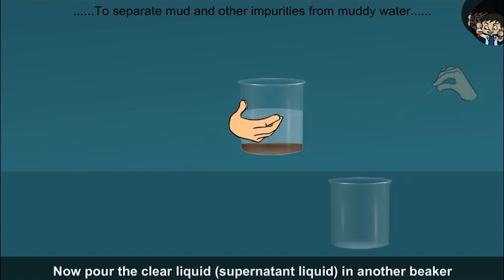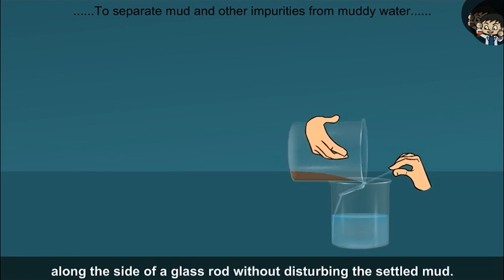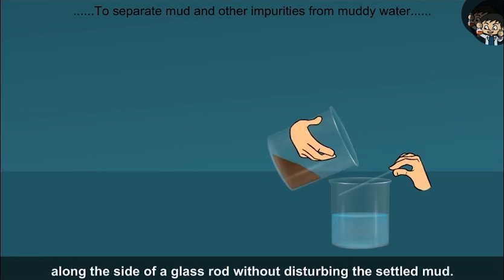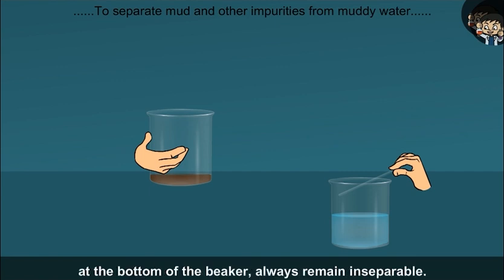Now pour the clear liquid into another beaker along the side of a glass rod without disturbing the settled mud. This process is called decantation. In this process, a small amount of the solution at the bottom of the beaker always remains inseparable. Filtration is a better method for such separation.